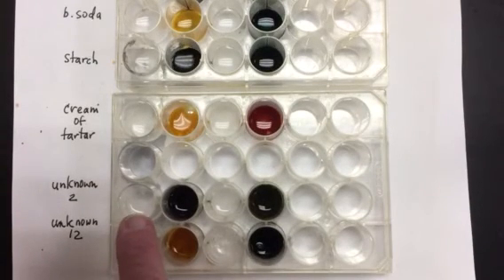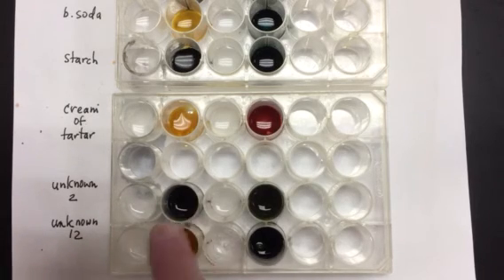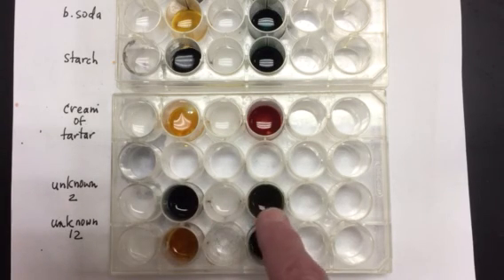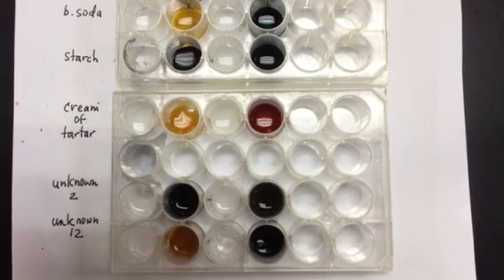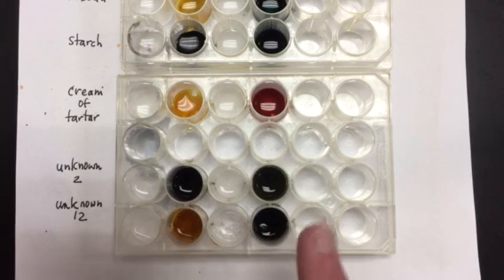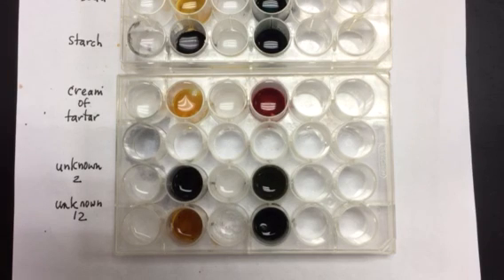So again, let's go over the unknown. With liquid 1, I don't see any sort of change, maybe there were some bubbles. This one turned dark, and I did see some little bubbles here. They're all gone now, but I saw some bubbles within there, and this one is looking greenish, but a different shade of green than we had before. Our unknown 12: nothing, lots of bubbles here, and no change here. So hopefully that's good enough for you to make an assessment of your unknowns.